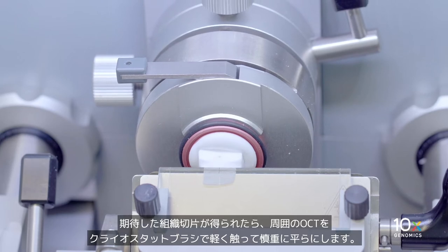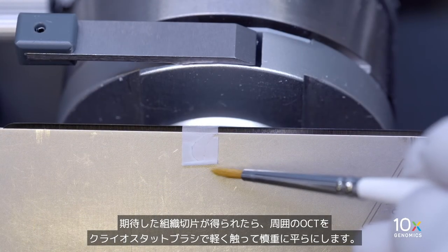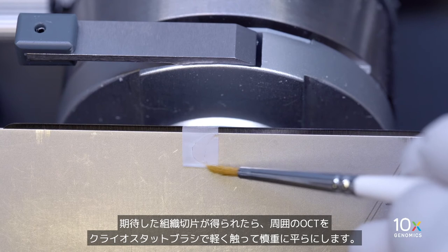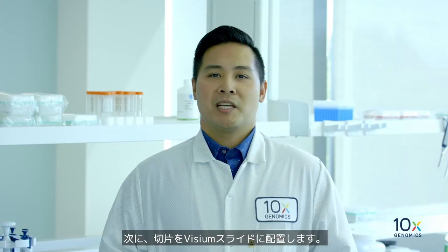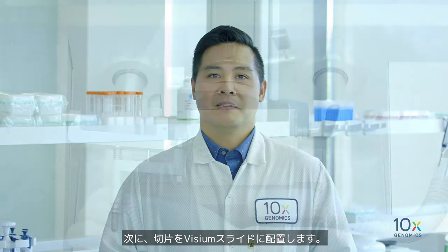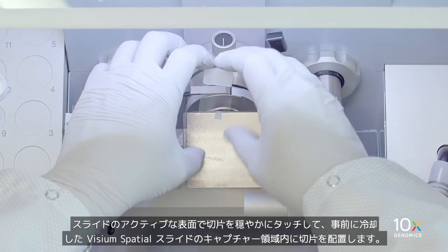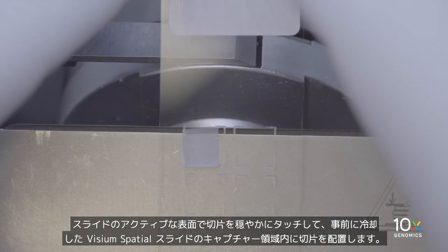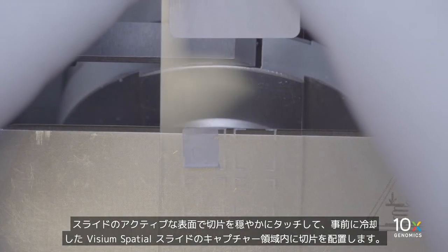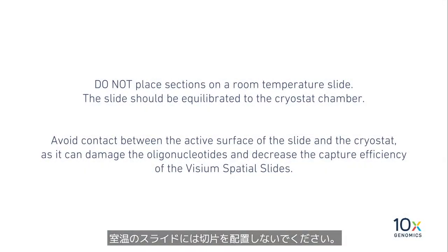Once the desired tissue section is obtained, carefully flatten it out by gently touching the surrounding OCT with cryostat brushes. Next, we will place the section onto the Visium slide. Place the section within a capture area on the pre-equilibrated Visium Spatial slide by gently touching the section with the active surface of the slide.